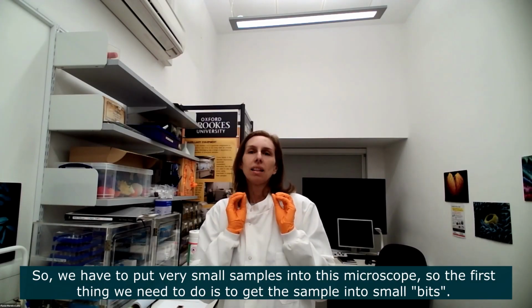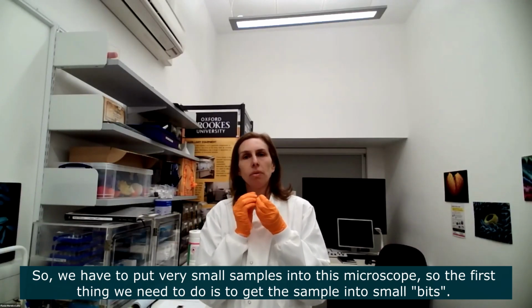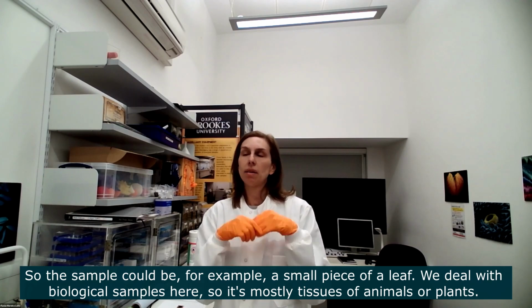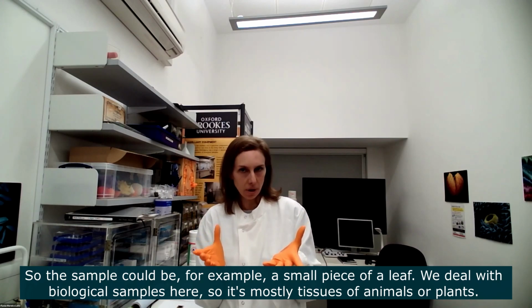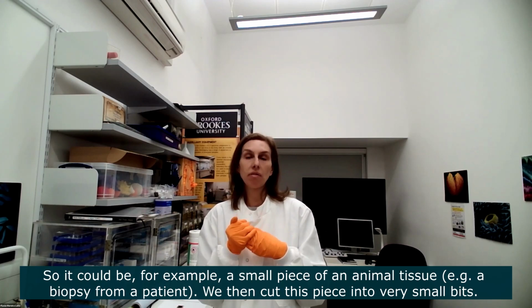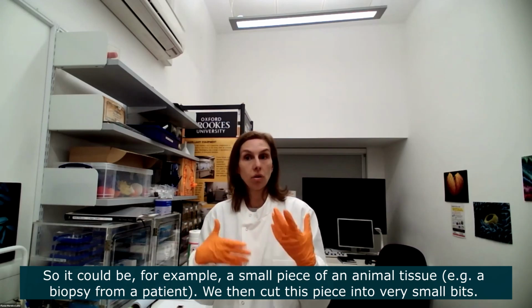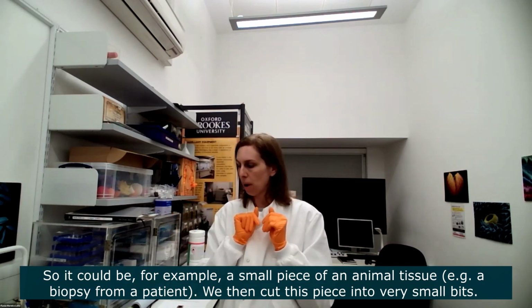So the first thing we need to do, so imagine we're putting very, very small samples into the microscope. The first thing we need to do is to get the sample into a very, very small bit. So it could be, let's say, a very small piece of a leaf, for example. We deal with biological samples here, so it's all tissues of animals or plants. So we could have, for example, a very small piece of an animal tissue. It could be a very small piece of a biopsy, something that the doctor has taken as a little piece from a patient, and then we cut these pieces into very small bits.